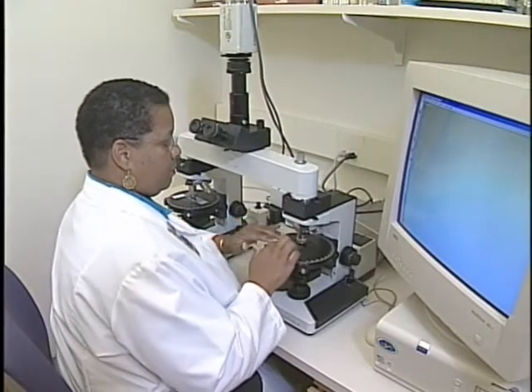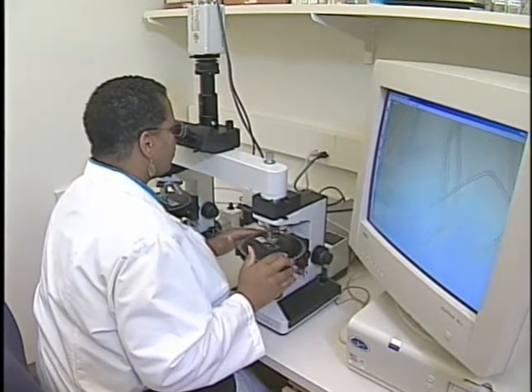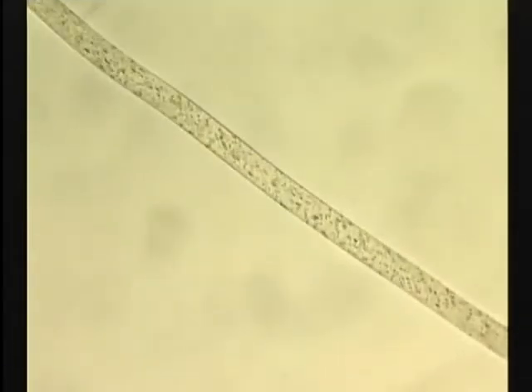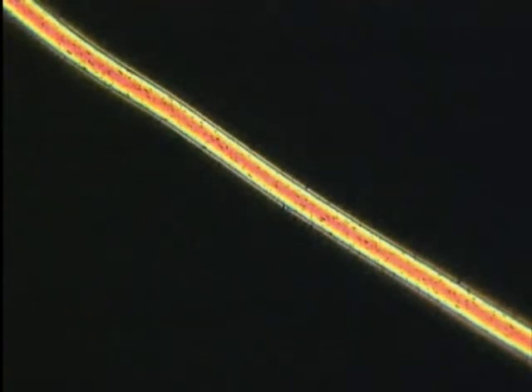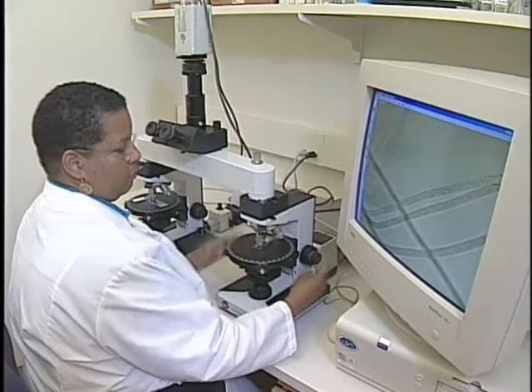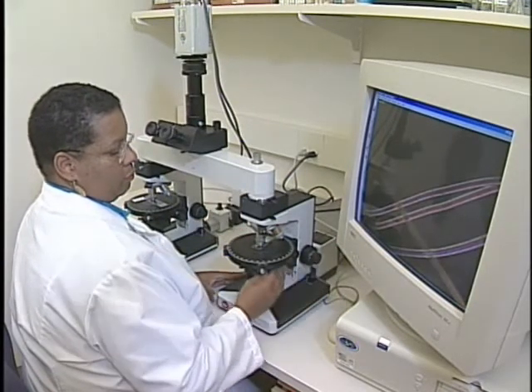Fibers often play an important part in the solution of a criminal case. Fiber evidence is placed under the microscope and exposed to polarized light — that is, light coming from one plane only. Comparing the speed of light through air with the speed of light through the fiber establishes the refractive index of the fiber. Using this instrument allows precise examination and comparison of fibers found at the crime scene with fibers found on or associated with a criminal suspect.